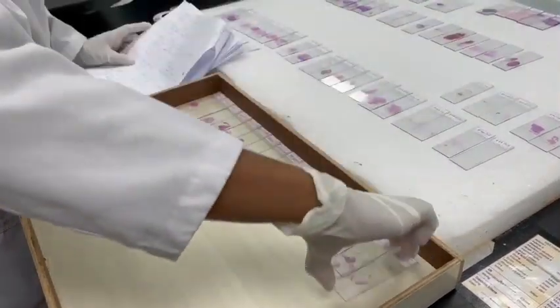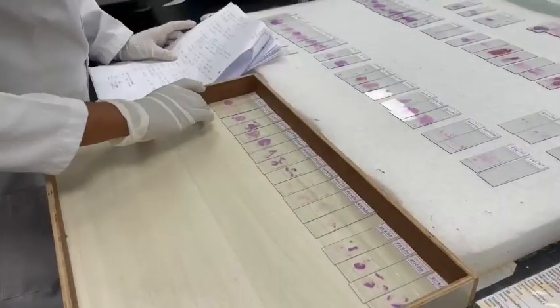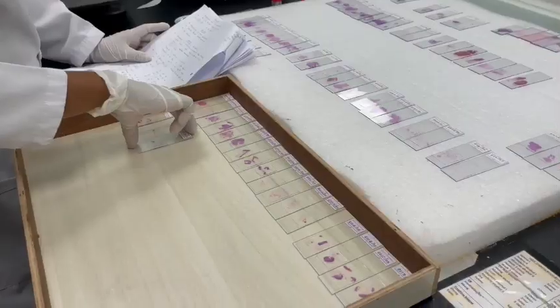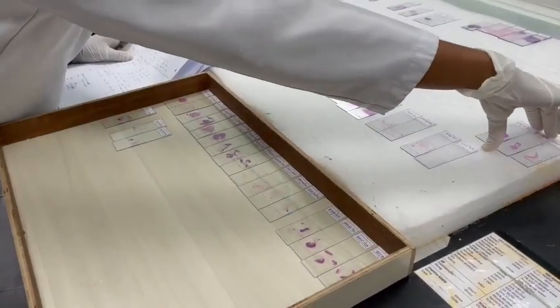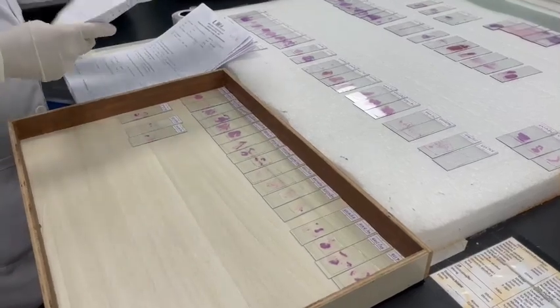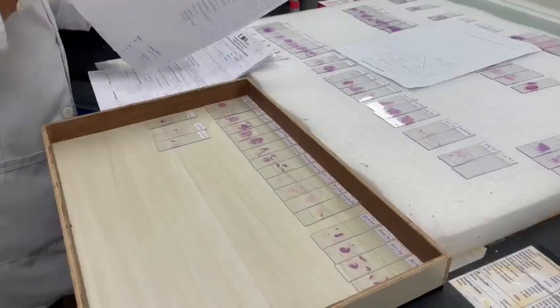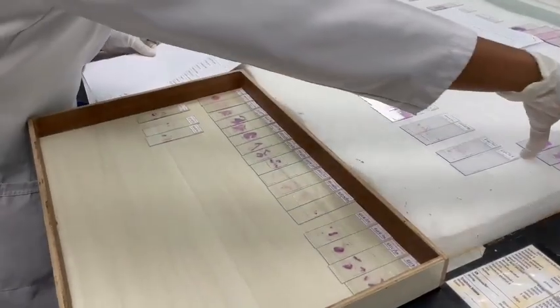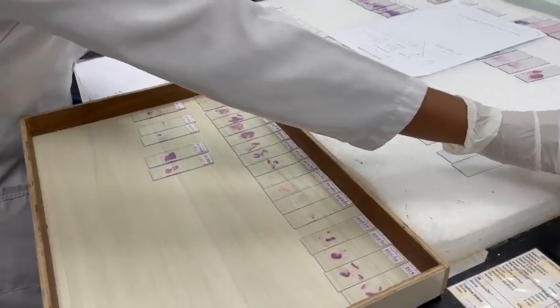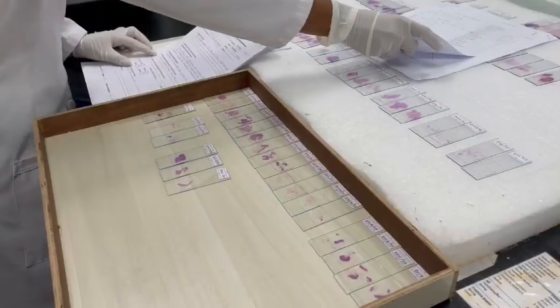Once the slides are ready, they should be arranged on a slide tray and given with the corresponding laboratory request form to the pathologist for reporting. The reports will be available as hard copies or through the hospital information management system. If the hard copies are being used, the relevant persons or units should be informed to collect the reports once they are ready. The signature of the person collecting the hard copy should be taken in the logbook prior to handing over the reports.